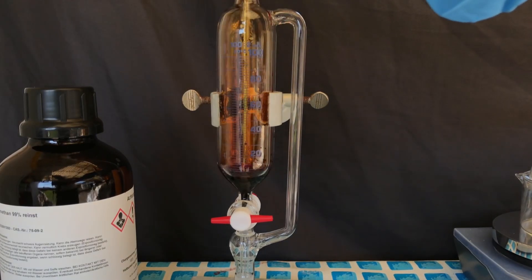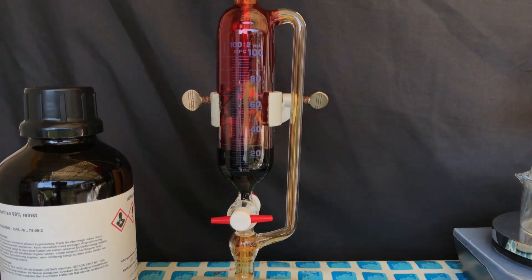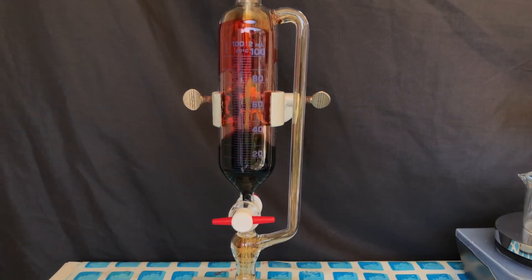At first, a pre-weighed amount of bromine was added to the addition funnel. While the bromine was being added, a lot of nasty fumes were released.